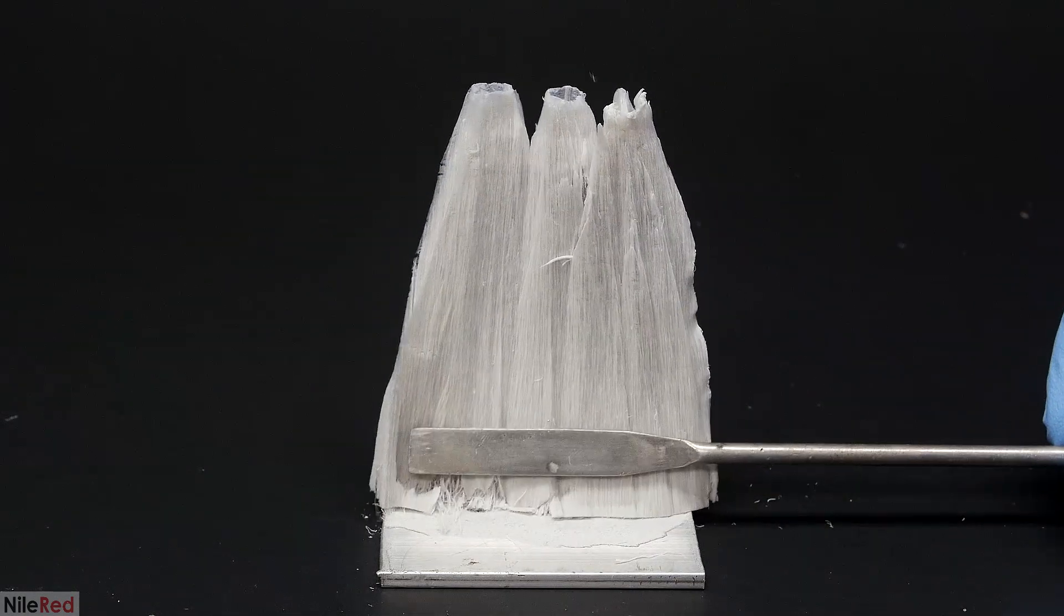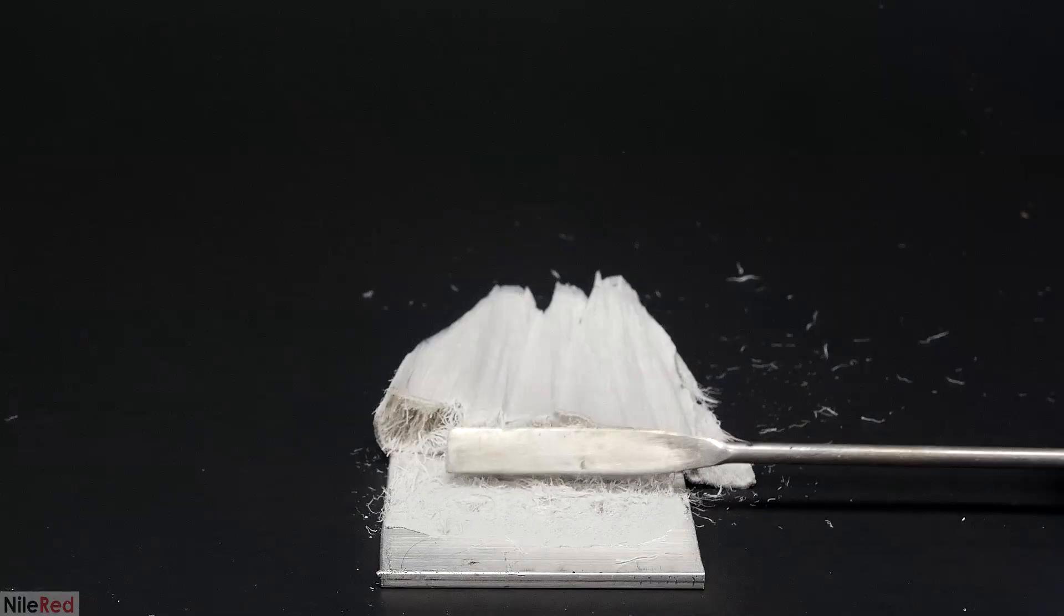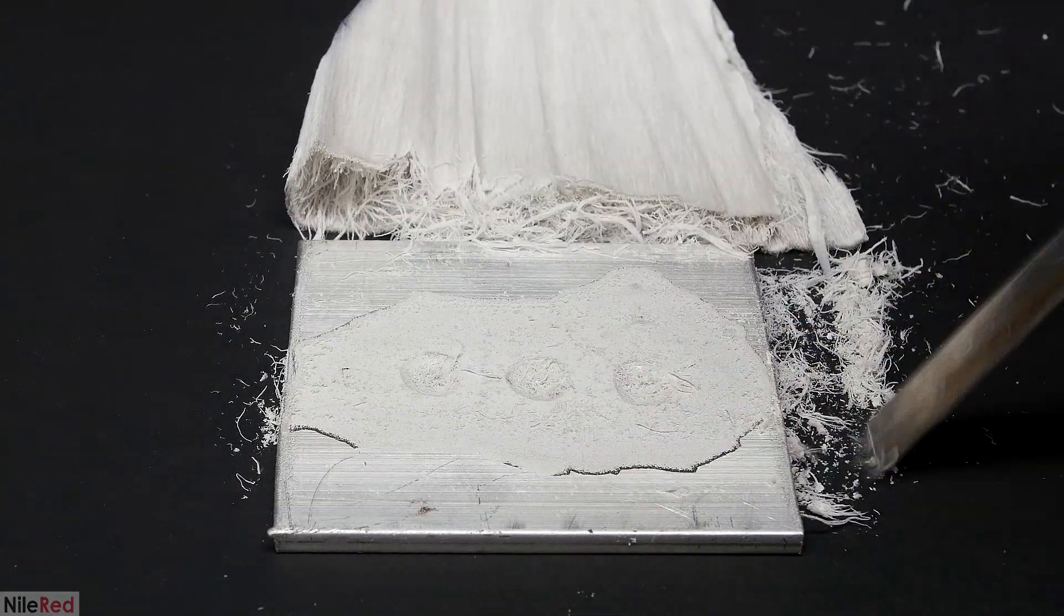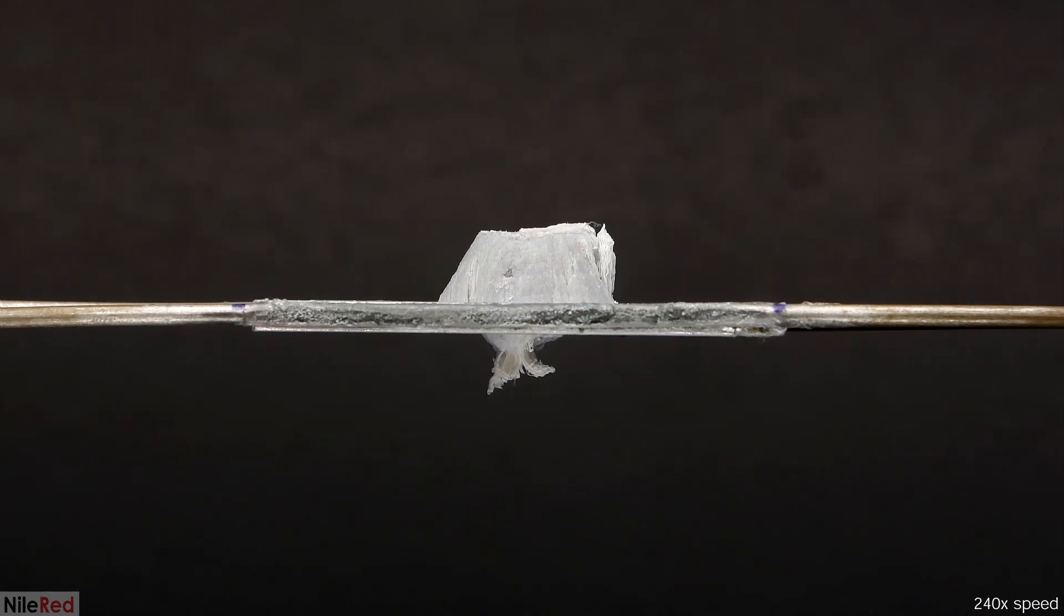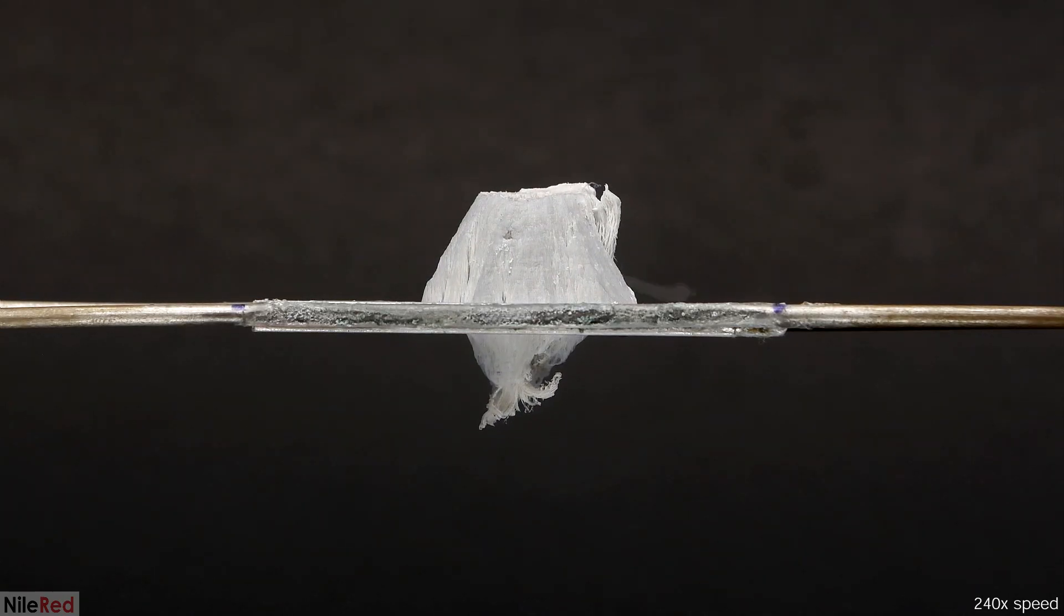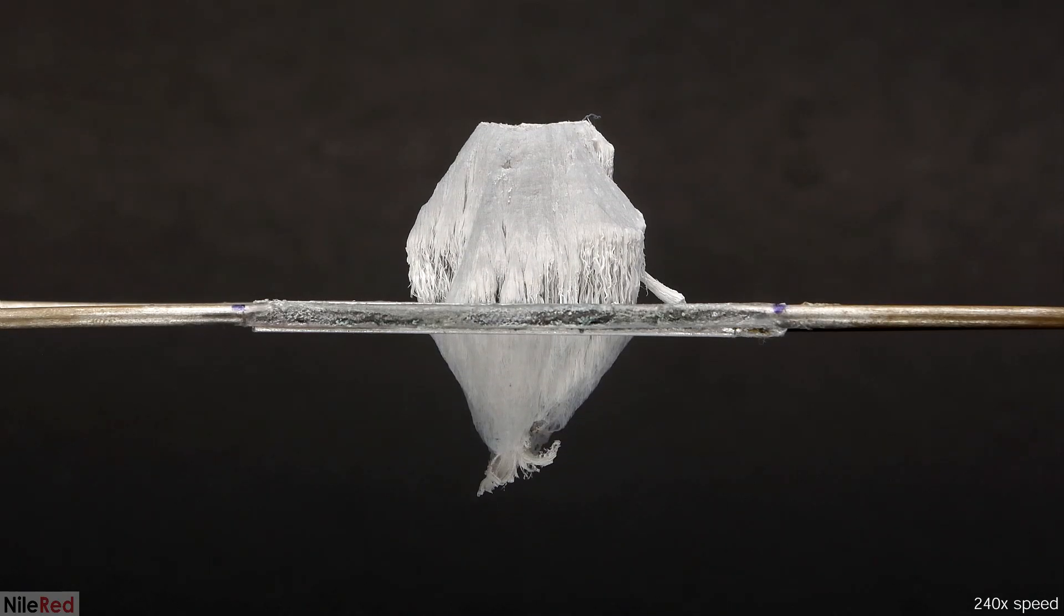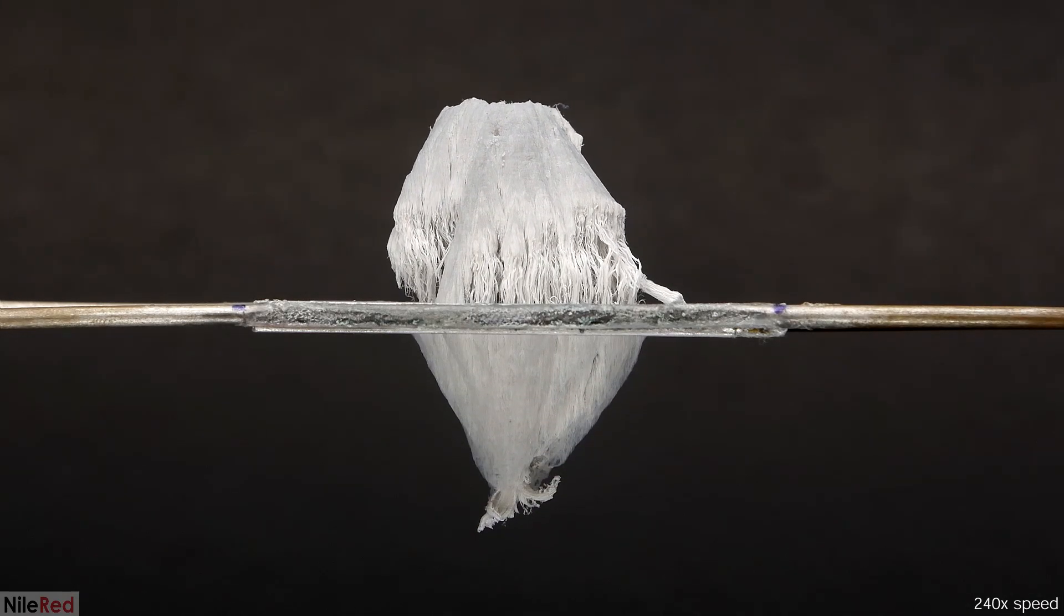If I knock everything down and clean up the plate, we can see that the amalgamated areas basically just combined together. Anyway, I think that's about it. I just really wanted to cover some of the questions you guys had. There's probably some other cool stuff that I could do with it, but this is going to be the last video because I feel like I've covered enough.